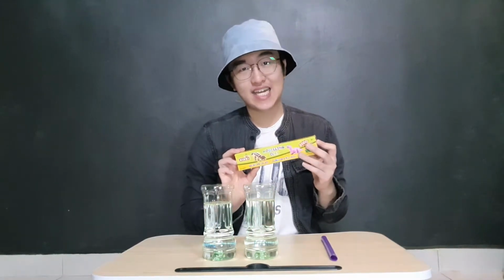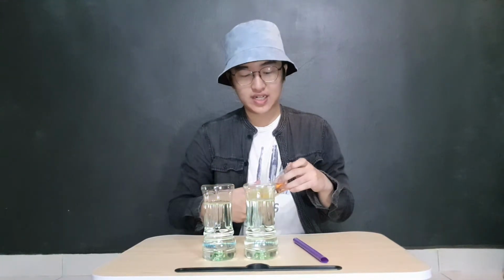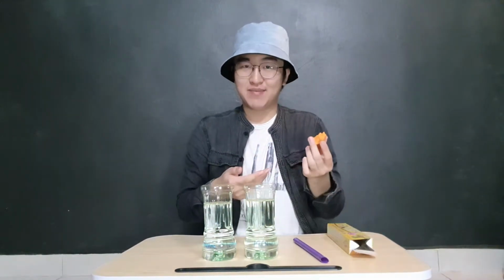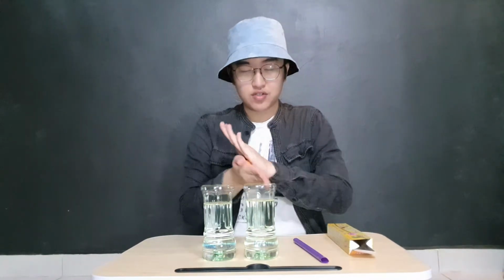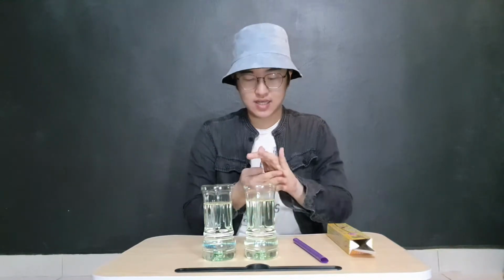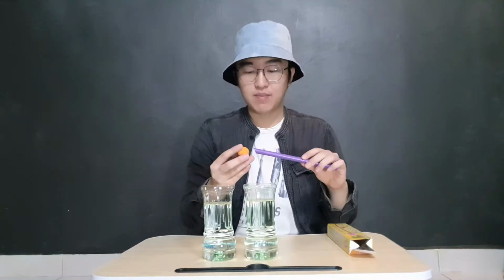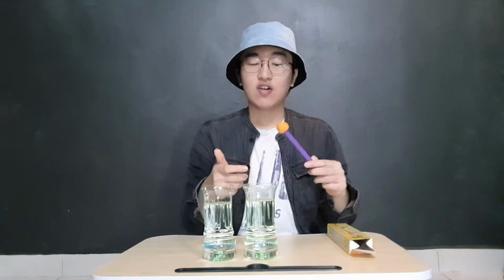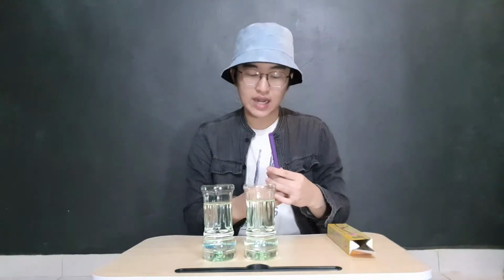First, we need a modeling clay and a straw. First, let me take out some modeling clay and squeeze it into a ball shape. Make sure there's no air and there's no space in between the modeling clay. So, after squeezing it into a ball shape, take a straw and poke the modeling clay at the end of the straw. Then use your finger to seal the connection between the clay and the straw to avoid air entering the modeling clay.